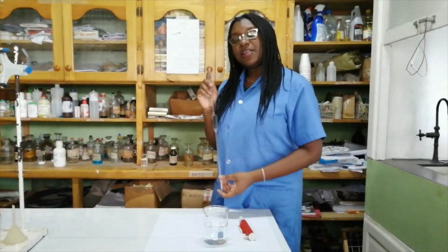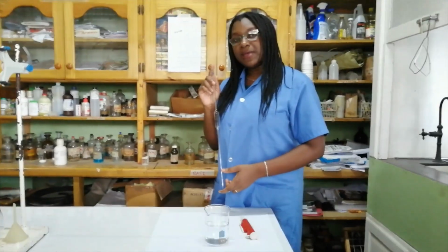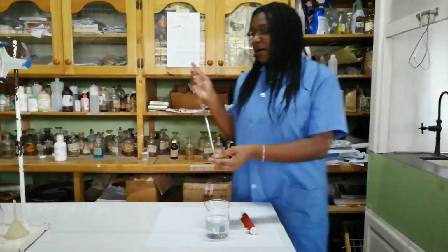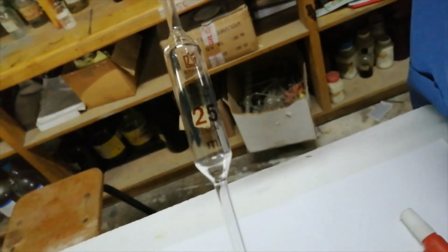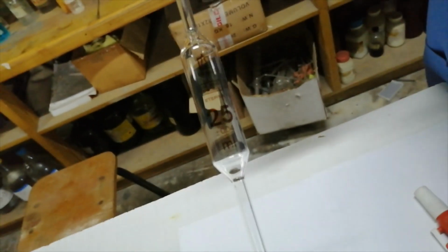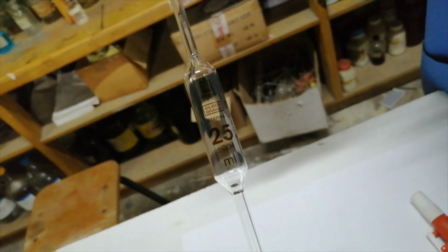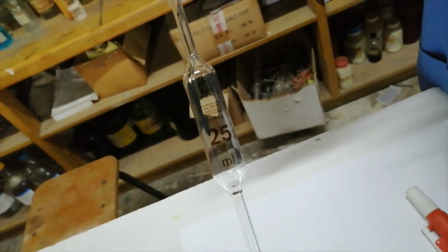If you're watching the American videos, you will hear them pronounce it pipette, but in Jamaica we call them pipette. So if you look at the markings here, you will see that this volumetric pipette can transfer 25 cm cubes or 25 mils of fluid. The error associated with that reading is plus or minus 0.04.